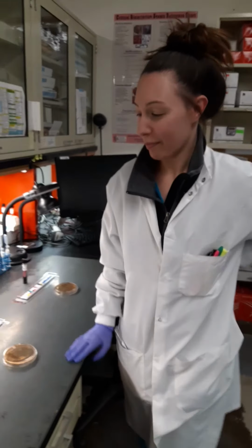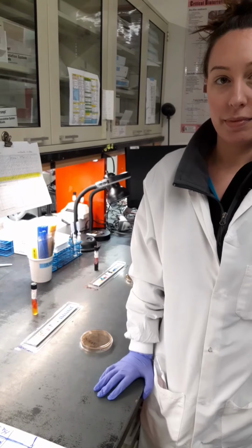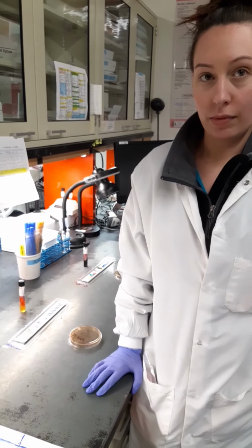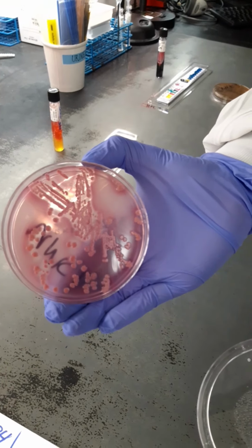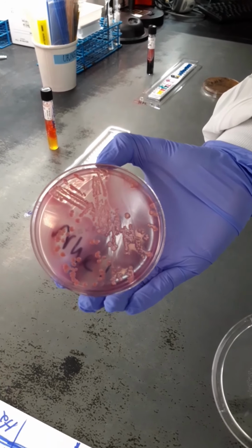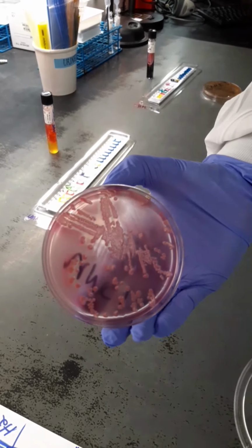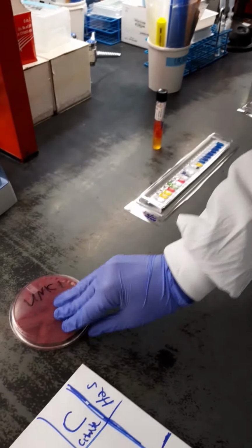All right, as you remember with Felicia, we set up 3 unknowns to see if the patients have Salmonella or Shigella causing their gastroenteritis. If you remember unknown 1, we saw that it was a lactose fermenter. So we said, could this patient have diarrhea caused by Salmonella and Shigella? And the answer was no, because it's a lactose fermenter. Shigella and Salmonella are enterics, but they do not ferment lactose. So you were all done with unknown 1, saying no Salmonella or Shigella.